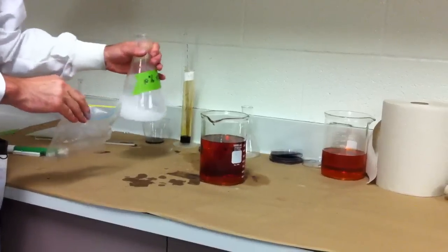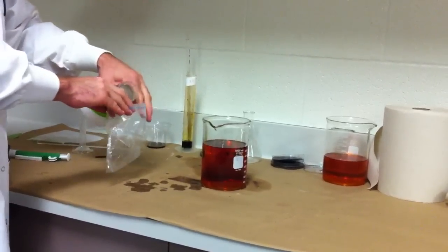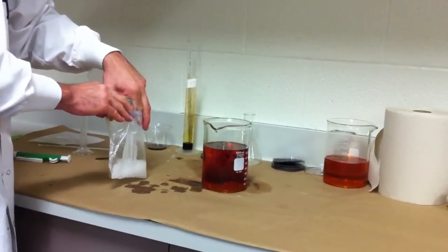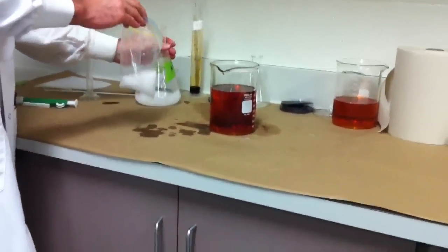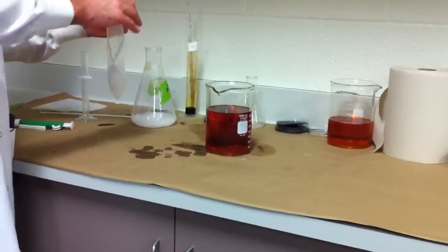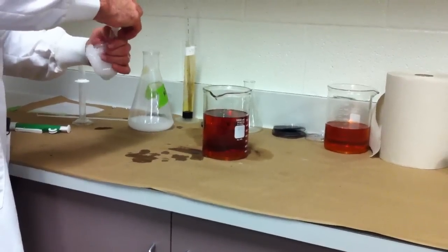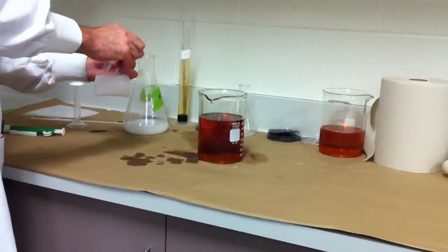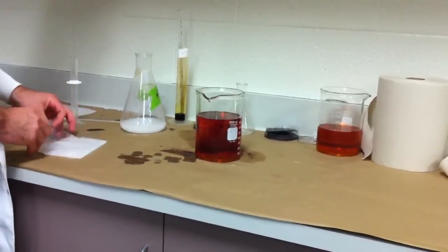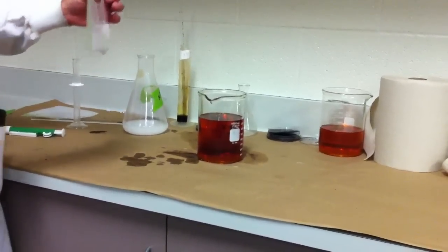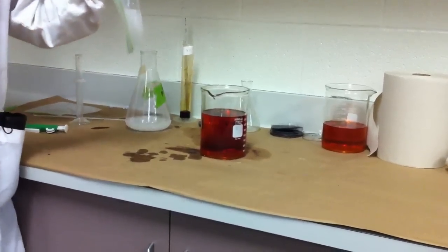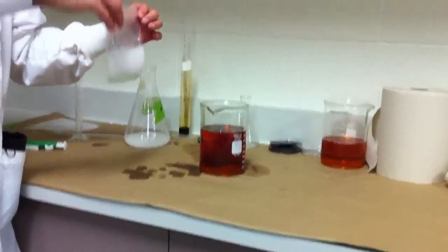So let's see if this bag... Good thing I didn't use it all, huh? Let's see if we can get all the air out. That's funny because this is the last period of the day, and I've done this experiment six times. And none of the other bags have done what that one did.